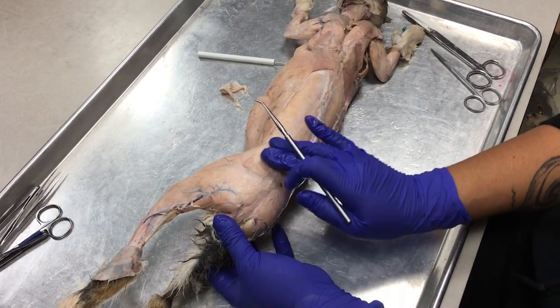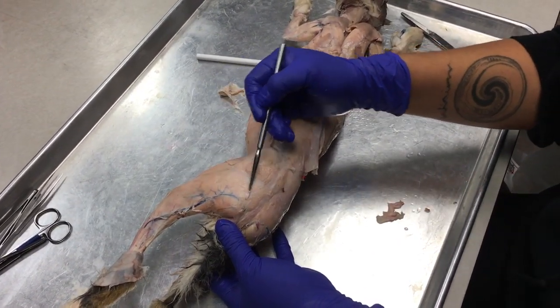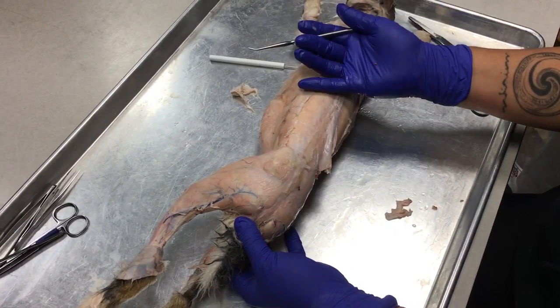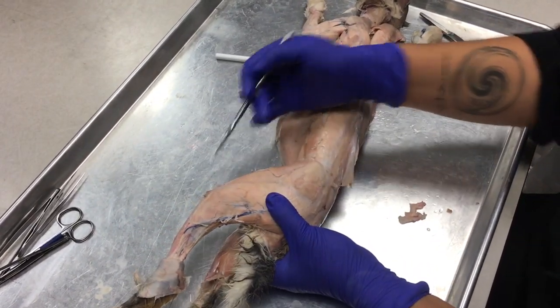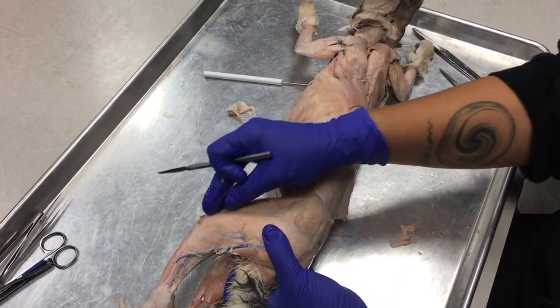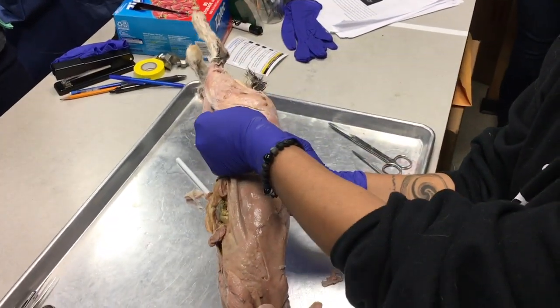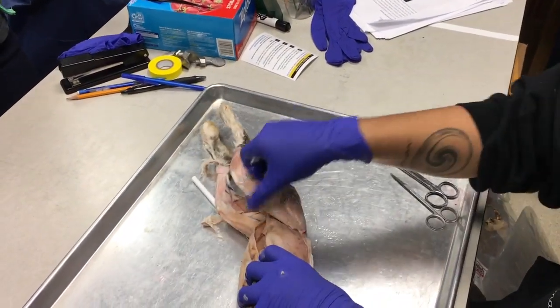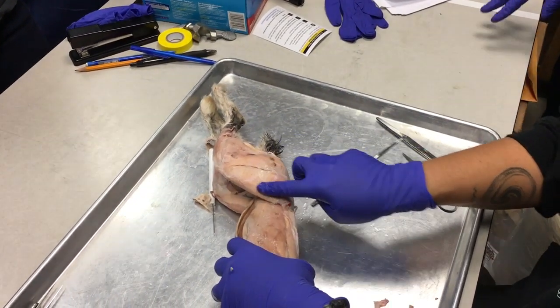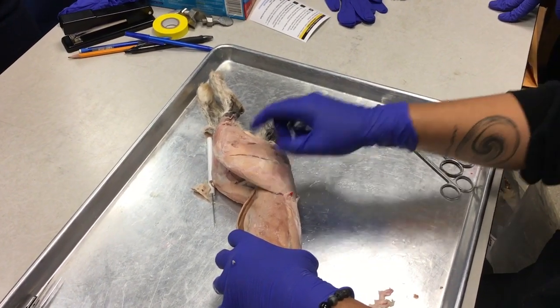Okay, posterior to that gluteus group is this huge sheet of muscle called the vastus lateralis. Okay, it's large and it's lateral, vastus lateralis. Anterior to the vastus lateralis on the leg, you're going to find a muscle and a really shiny tendon. Let's see. It looks like she cut it on both sides, but you can see the remnants of that tendon. It covers the area between the vastus and this anterior leg muscle right here.